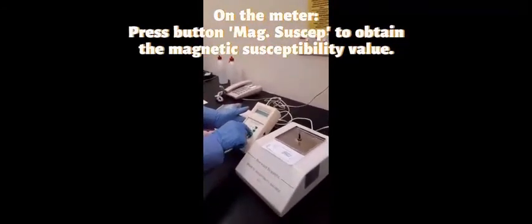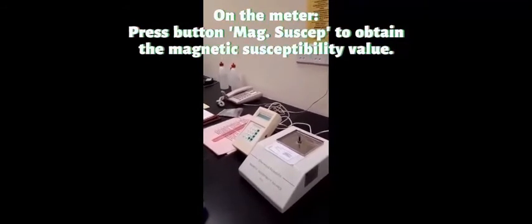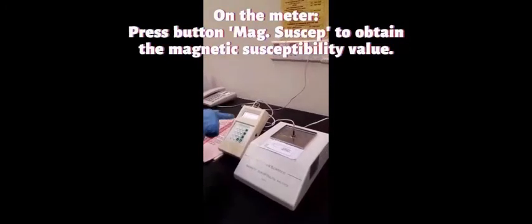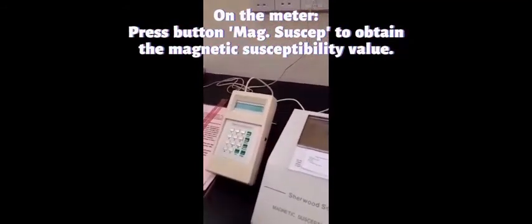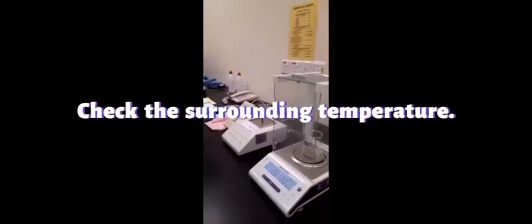And then we press magnetic susceptibility. The magnetic susceptibility value for this compound is 0.280 times 10 to the minus 4 M. And don't forget to also check the temperature of the surroundings, because the temperature will be included in the calculation.